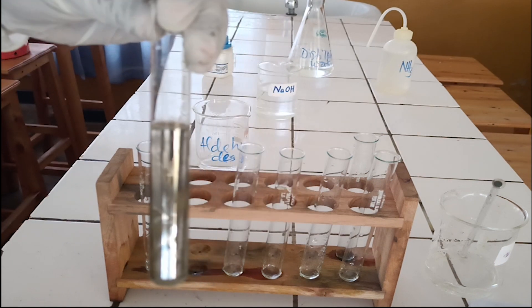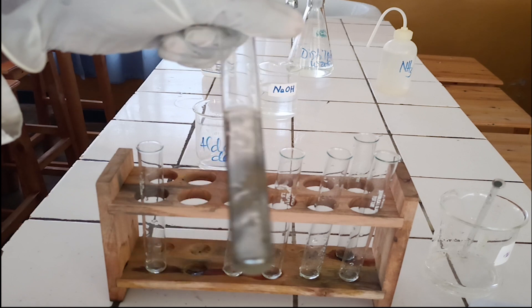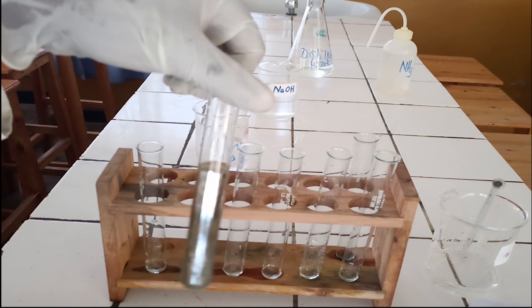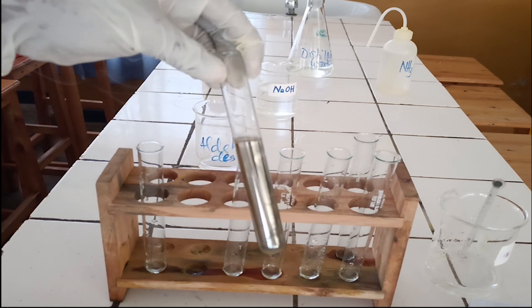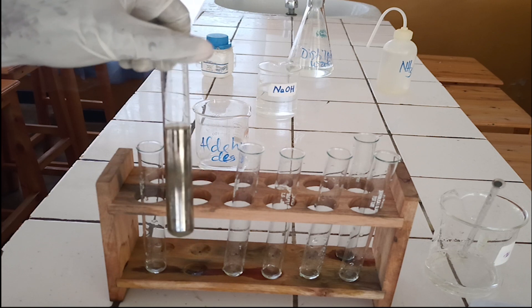Listen carefully. The colorless solution produces a silver mirror on the wall of the test tube. The formation of a silver mirror on the wall of the test tube is a positive test, indicating that the analyte solution contains aldehyde.